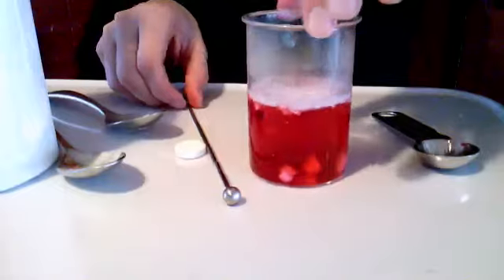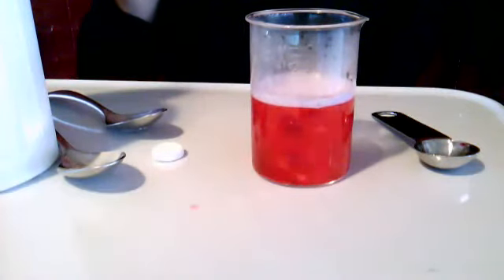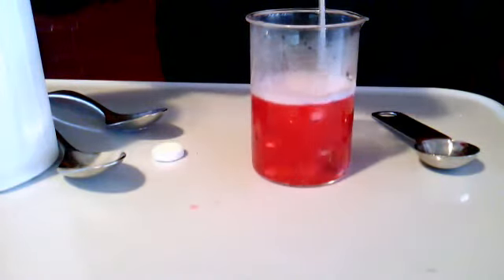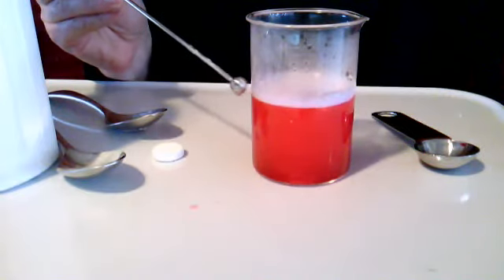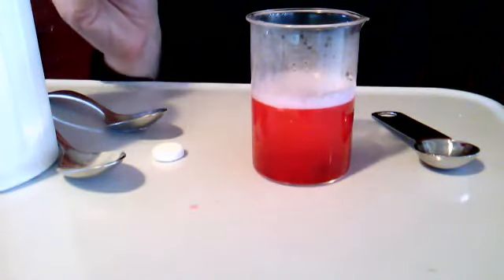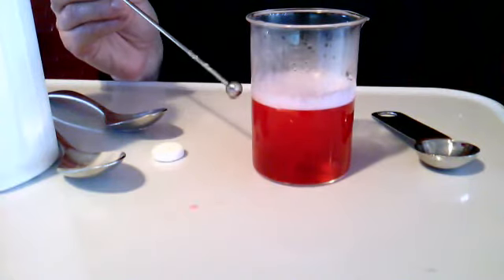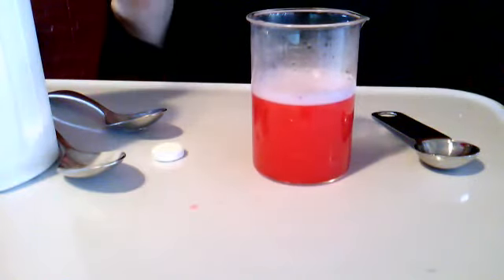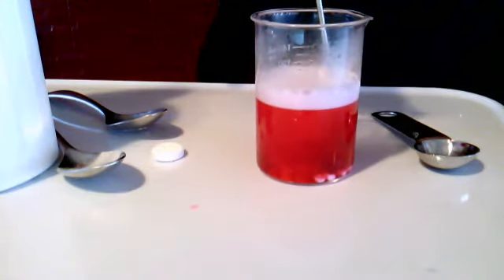You can see what's happening. I'll move the numbers to the back. Give it a little stir. Our stomach, being a muscle, is smooshing our food around and mashing it up. It makes a really good stirrer for us. We've got a little bit of frothiness. So if you've ever had an upset stomach and you choose to take some Tums, something you'll do is burp because it's making a gas with the different reaction in your stomach. Now at this point, not much change has happened other than our fizzing.